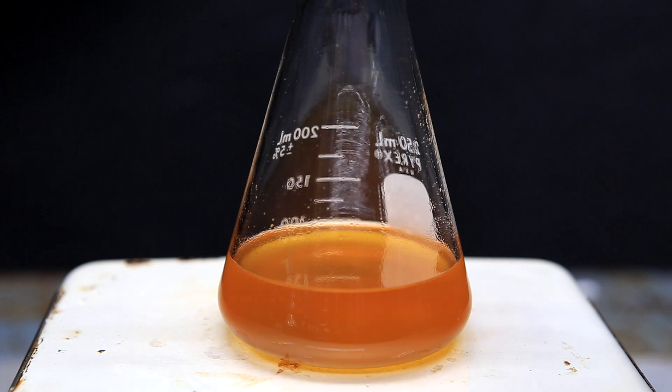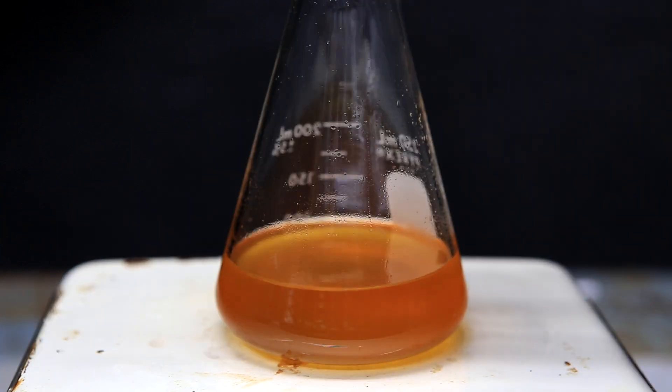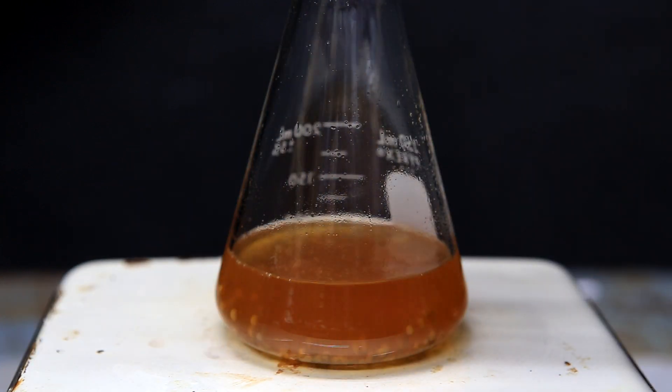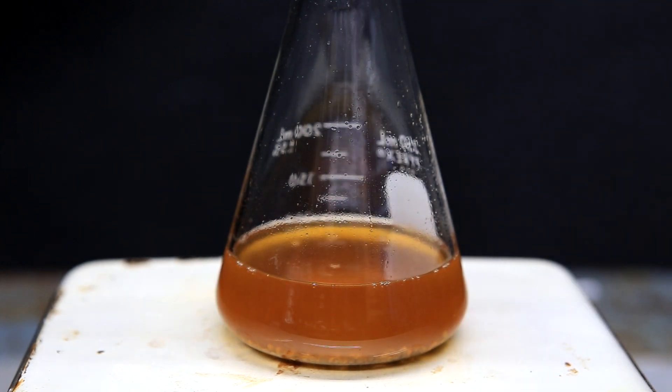So now we're left with about 100 milliliters of a dichloromethane phenylhydrazine solution. It's a little bit wet with water so the first thing we do is add molecular sieves. When the sieves are added, it looks like the solution gets darker but there's not actually a reaction occurring.